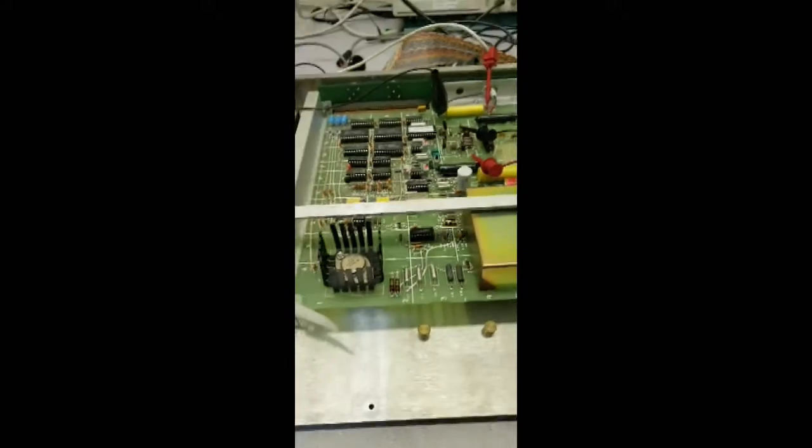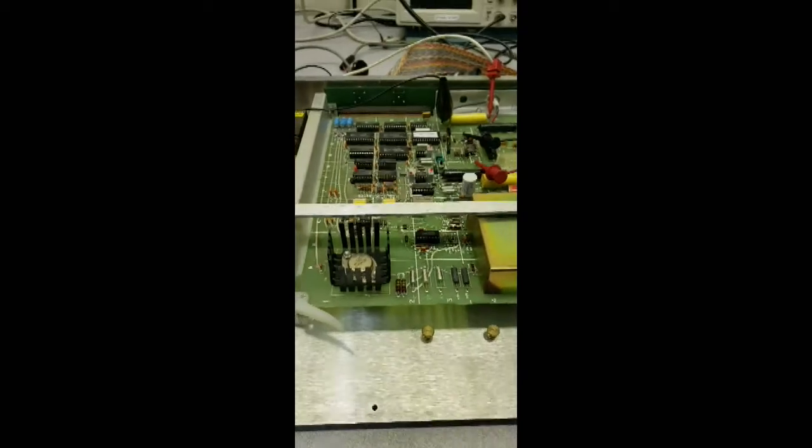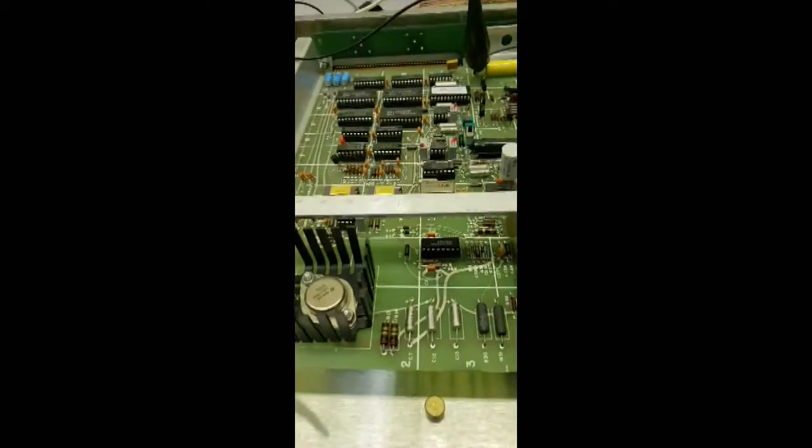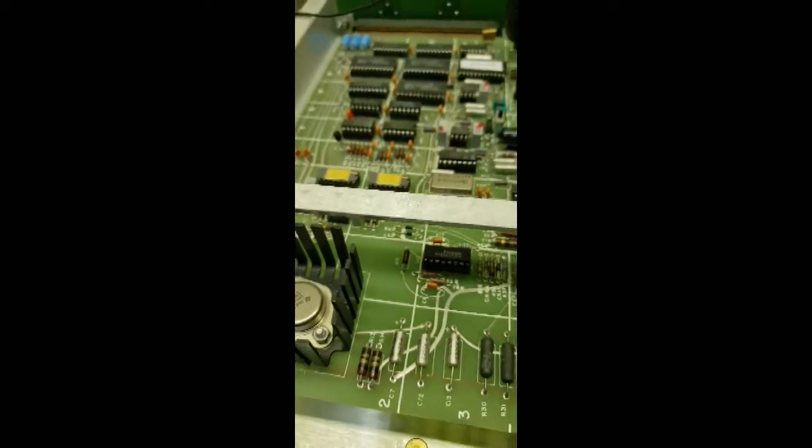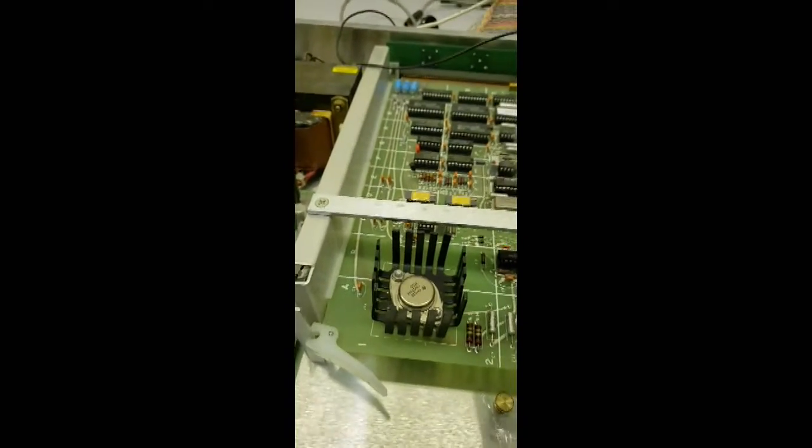Okay, I'm back to the video. It's taken me a couple of minutes to isolate this down, but I finally got it. It's basically R15 right here. And so what I can do now is take the heat gun and heat up R15.